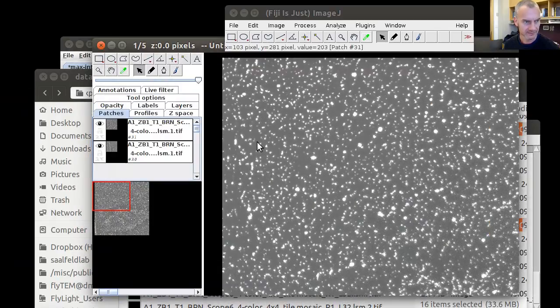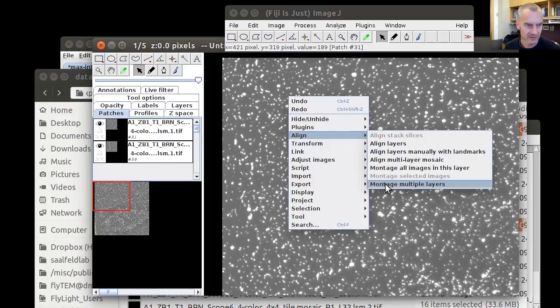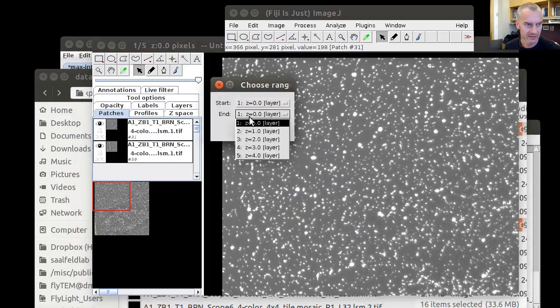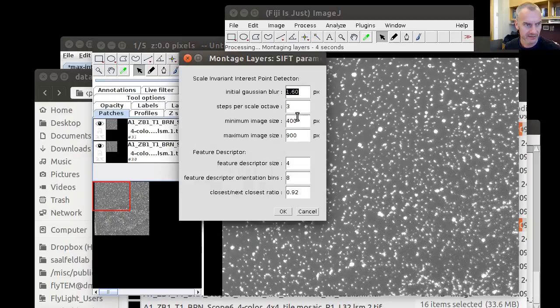Close this window again. And now, in order to get a better idea of how the montages look without lens correction, we're going to montage these images first. Do this in the Align menu, montage multiple layers from first to last, using the least squares feature-based method. We're changing the feature extraction parameters such that the minimum image size is 400 pixels and the maximum image size is 900. Something around that range will always work.